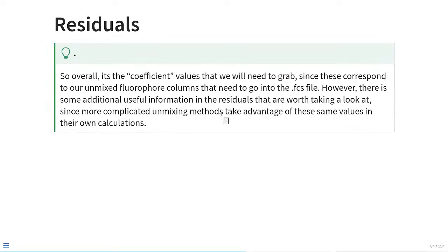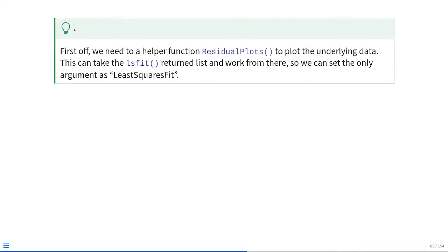Alright, so overall, it's the coefficient values that we will need to grab, because they correspond to those unmixed fluorophore columns that we want to place into our new unmixed FCS file. However, there's some additional useful information within the residuals that is worth taking a look at, since some of the newer, more complicated unmixing methods take advantage of these values for their own calculations. So first off, let's write a small helper function to help us visualize the residuals. We're going to call this one residual plots. Basically, it can take the lsfit output directly, which is that list, and work from there. So its only argument needs to be the least squares fit.